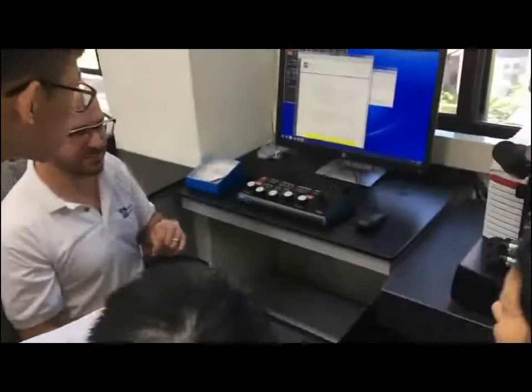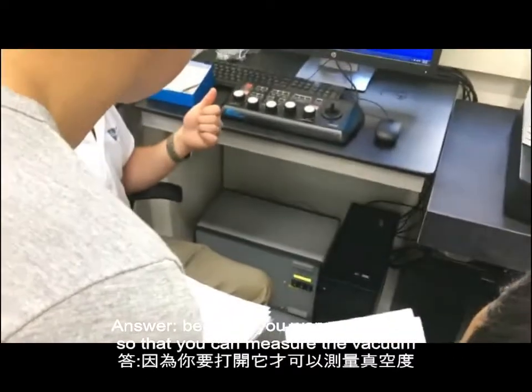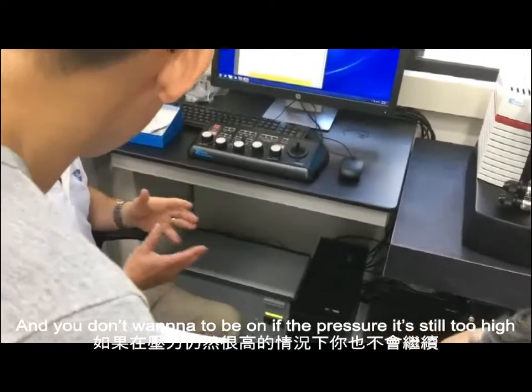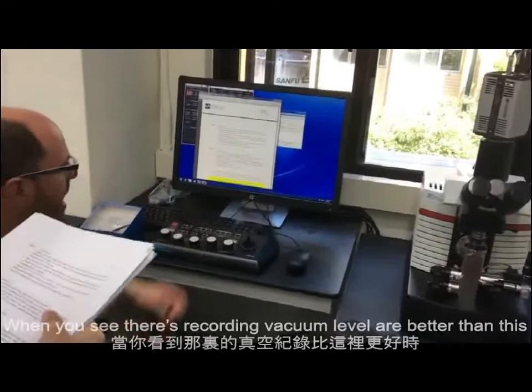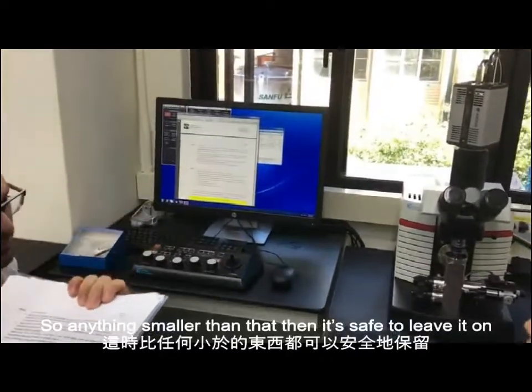Yeah, exactly. But why do you do on and off? Because you want to turn it on so that you can measure the vacuum. You can only measure the vacuum when it's running, and you don't want it to be on if the pressure is still too high. And you want to give it a chance to rest, so 3 minutes in between. And when you see that it's reporting vacuum levels that are better than this, so anything smaller than that, then it's safe to leave it on.